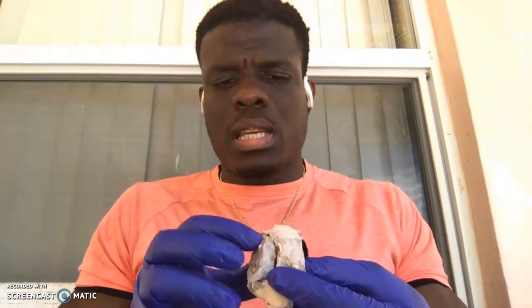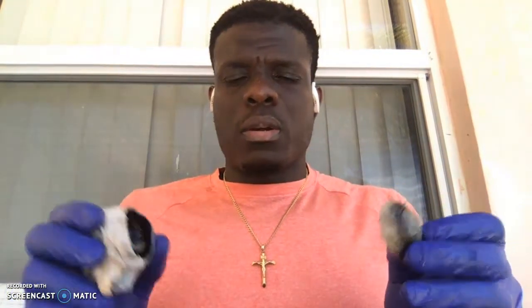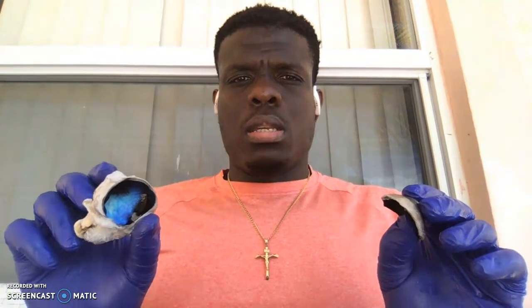Like I said, some of the structures unfortunately got messed up during the dissection. I couldn't show the aqueous humor. The vitreous I couldn't really show. But aside from that, most of the structures are pretty similar as far as what we see in the human eye versus what we see in the cow's eye as well.